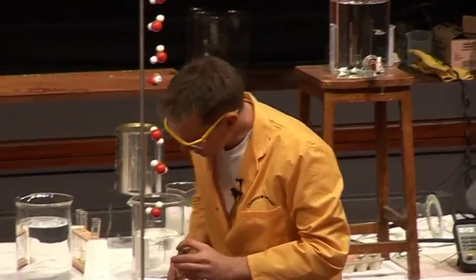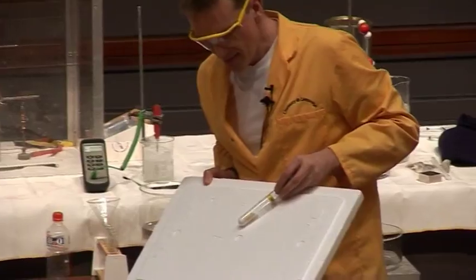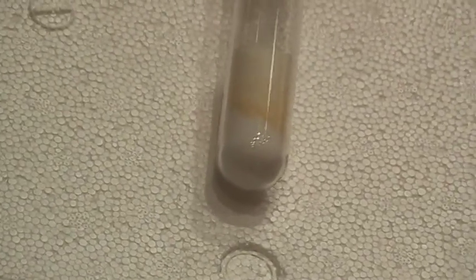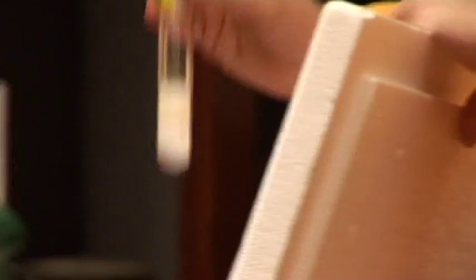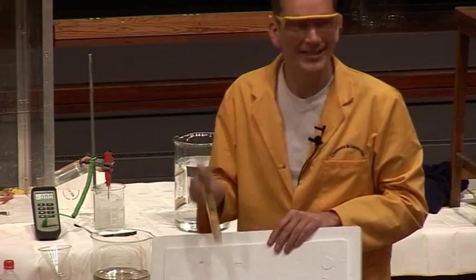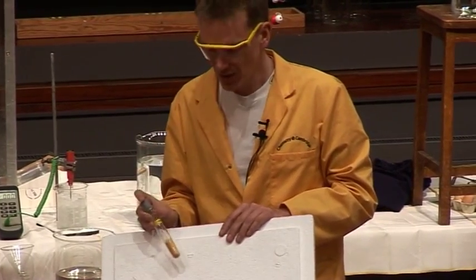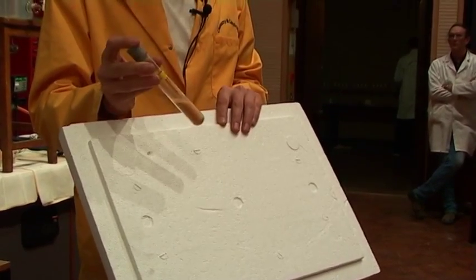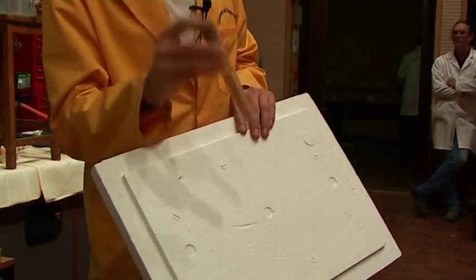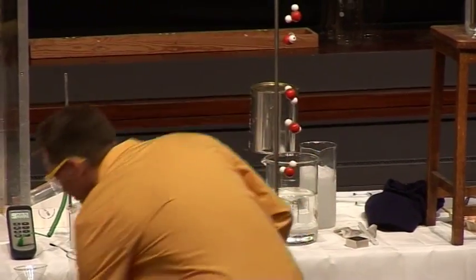I'll get a white background for this. You may be able to see where they're mixing — there's actually a yellow line in between the two of them. If I shake this up, we get a distinct color change. We see a yellow color here now. This is a reaction that's taken place between two solids. The lead nitrate and potassium iodide have formed lead iodide — that yellow color. It's very unusual to see a reaction between two solids.